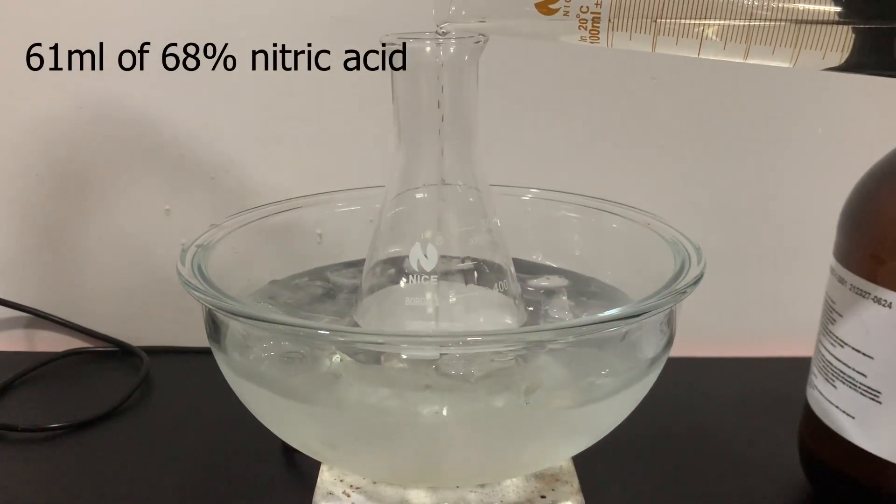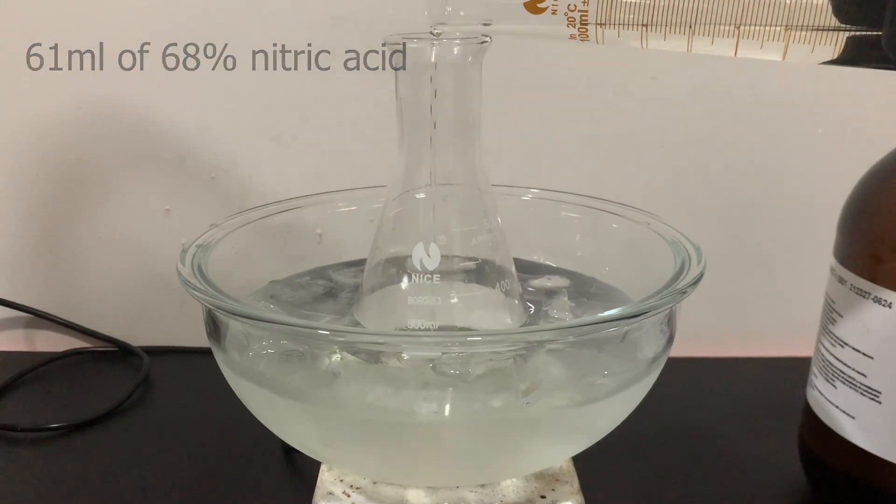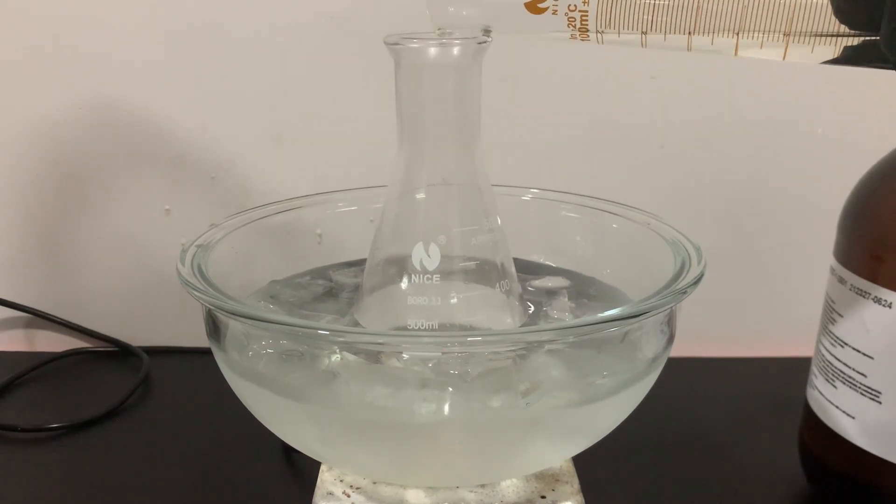With strong stirring, 61ml of concentrated nitric acid is slowly added to the sulfuric acid.